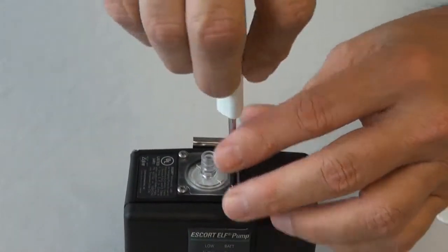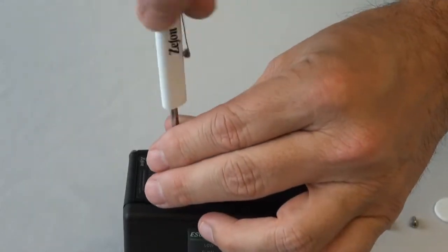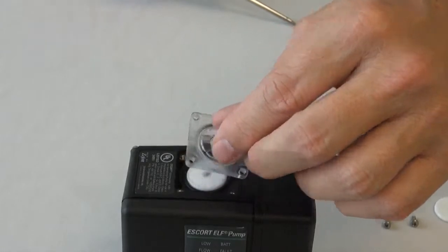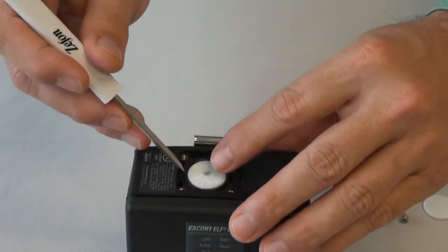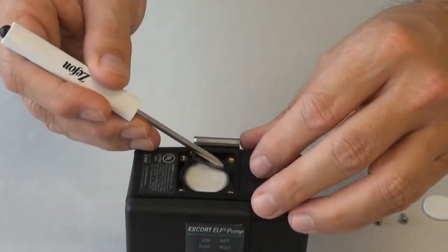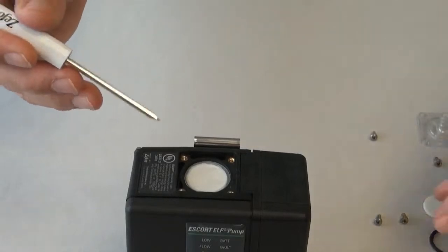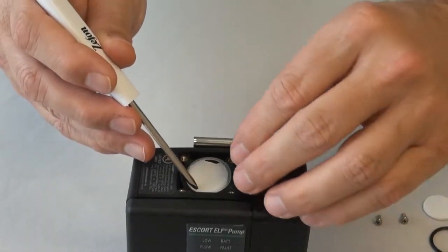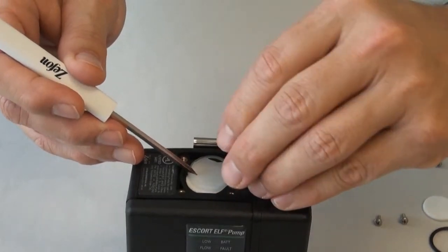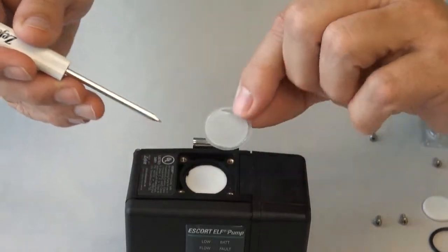To replace the filter, first remove the 4 screws holding the inlet filter cover. Remove the filter cover, the inlet dust filter, and the O-ring. If you are using the optional Teflon water stop filter, it should be removed and visually inspected for holes or other damage. Be very careful when removing and assembling, as it is very fragile and must be handled with care.